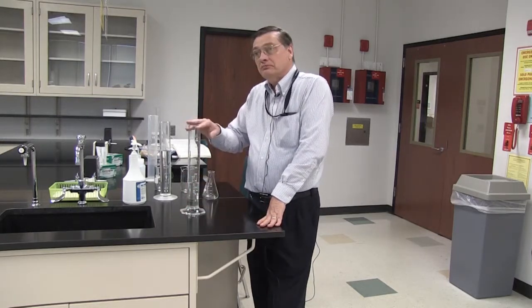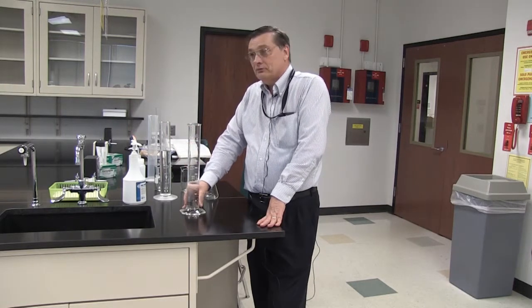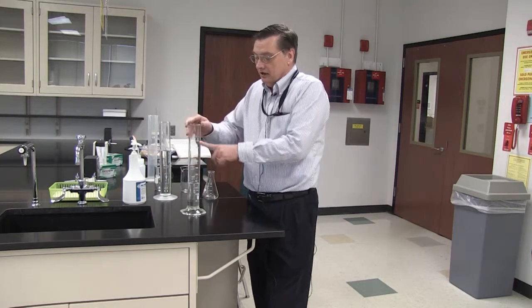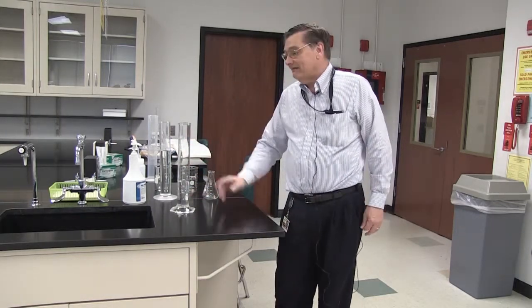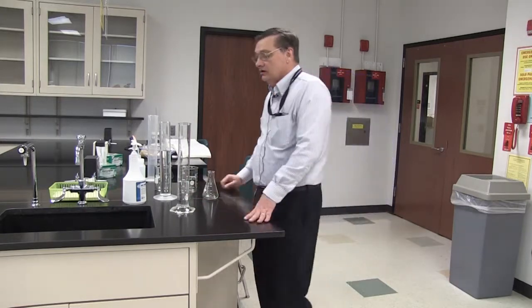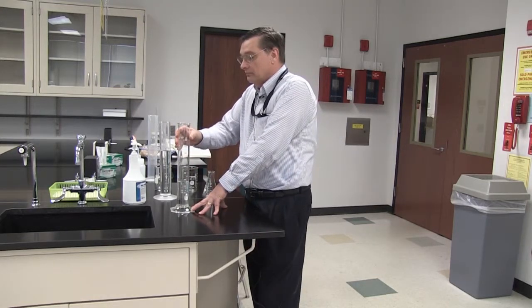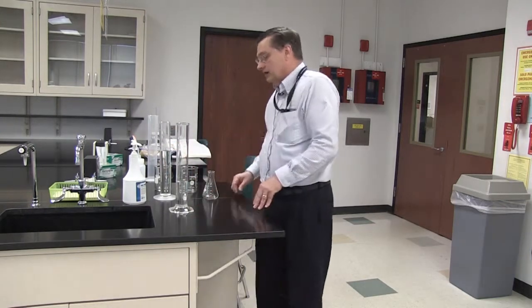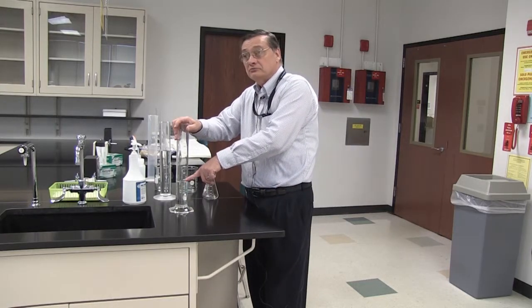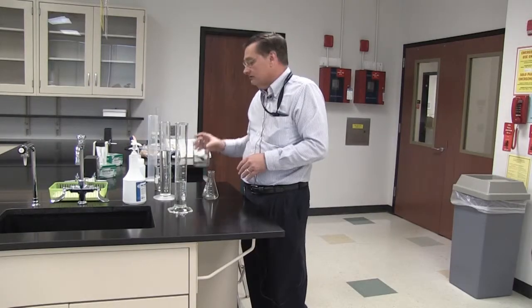Okay. The graduate is probably the principal device used in the laboratory for preparing solutions. This one is a 500 milliliter graduate, so it could obviously be used for anywhere up to 500 mils and incremental values in between. And you notice its height, being cylindrical, gives it a form to create a meniscus. Right? And we discuss reading the volumes by reading the volume of the meniscus. The narrow cylindrical form forms a much more discernible meniscus even than a wide flask would.